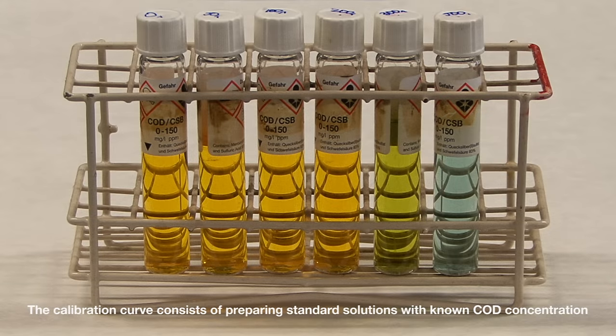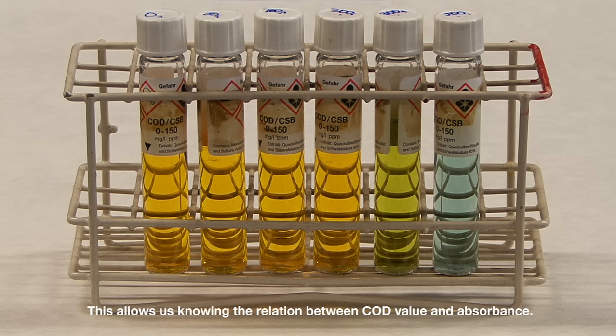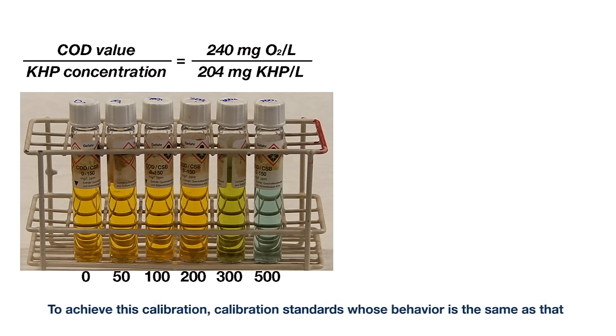The calibration curve consists of preparing standard solutions with known COD concentration and determining their absorbance at a given wavelength. This allows us knowing the relation between COD value and absorbance.